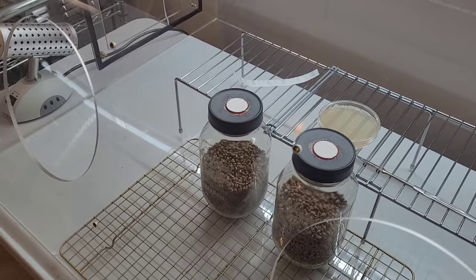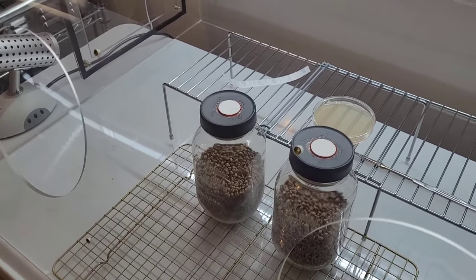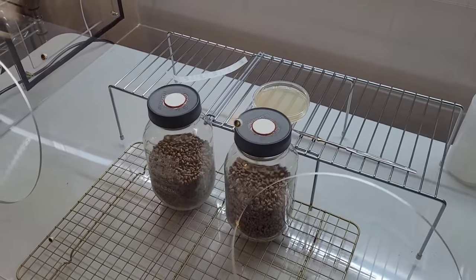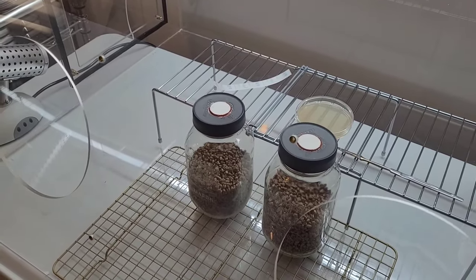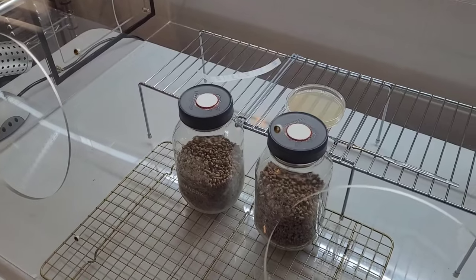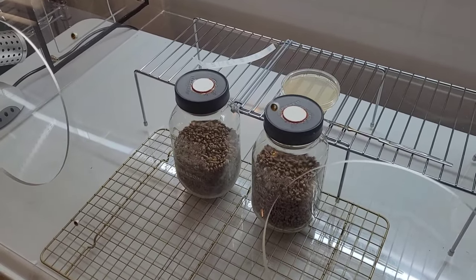So I do not suggest adding blowers, filters, turning it into some sort of still air box flow hood Frankenstein kind of monstrosity. None of that's necessary. It's actually counterproductive.